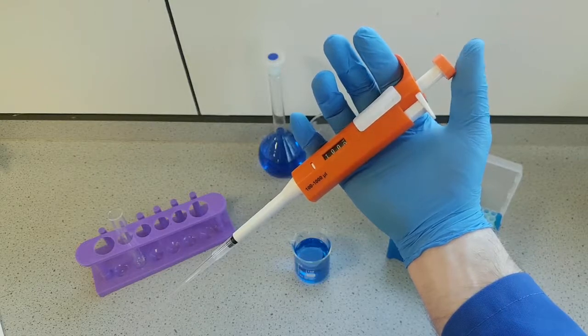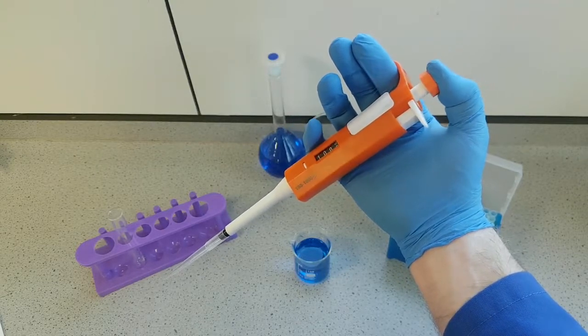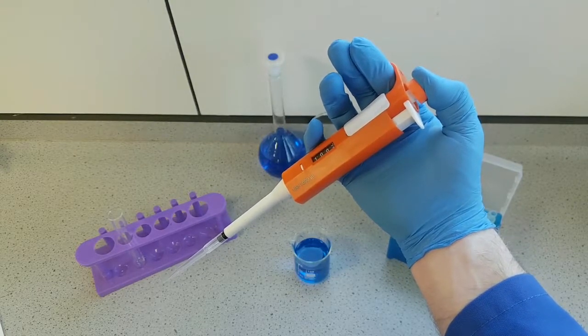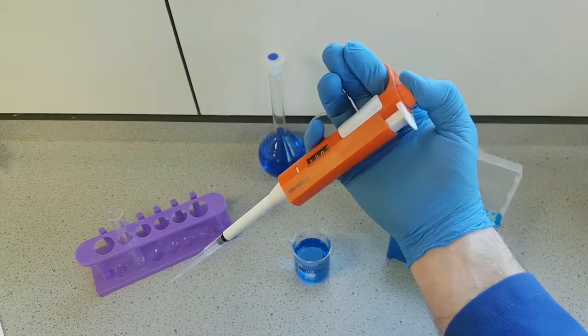Now to operate our auto pipette, there is a two-stage press button here. So that's our first stage, and then press a little harder, that's our second stage.